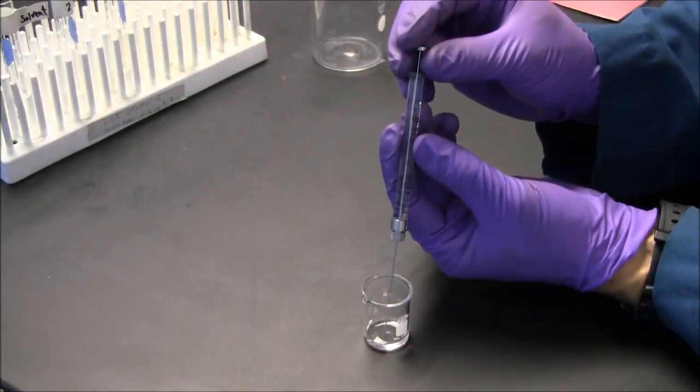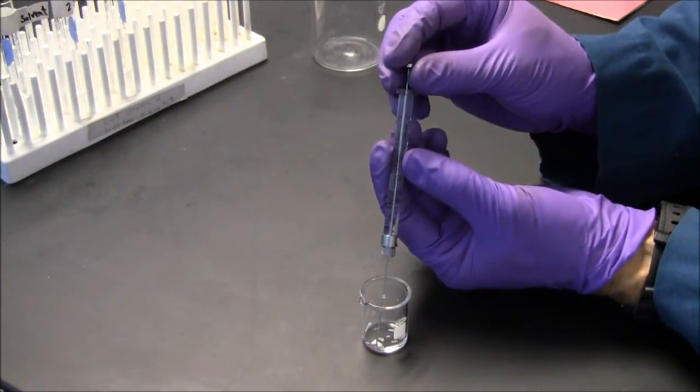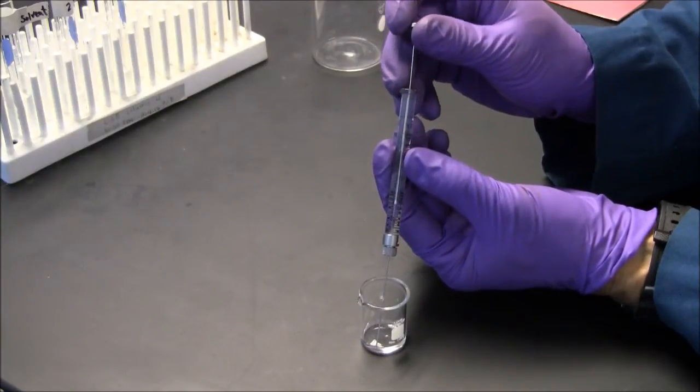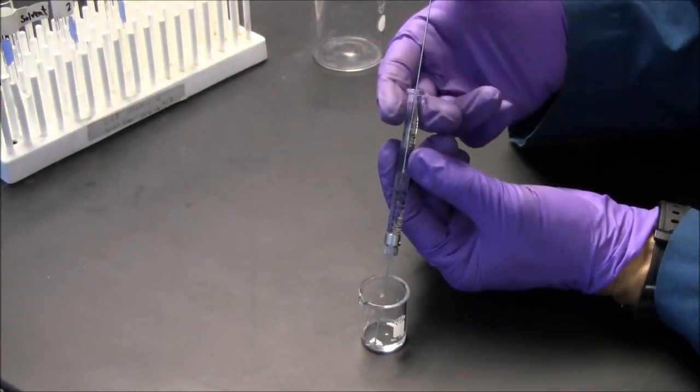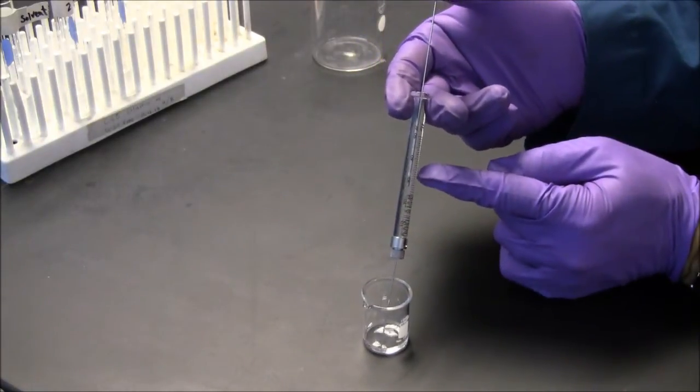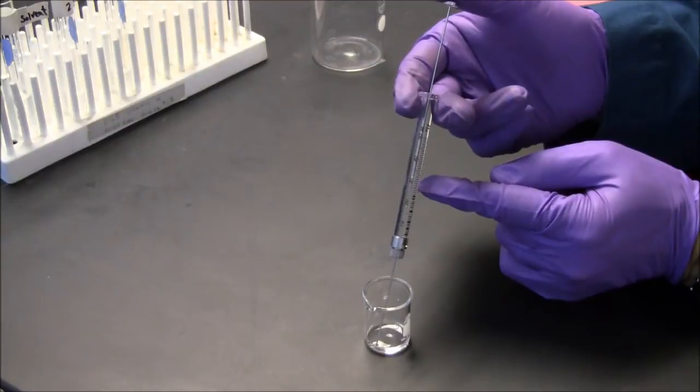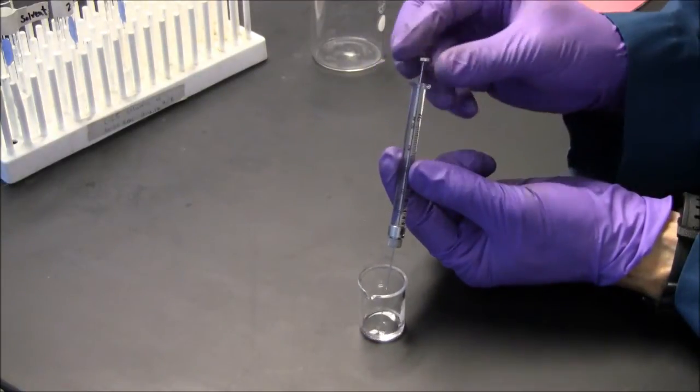So here, use is very intuitive. I will pull up the plunger when the tip is immersed in the liquid. I can see there are air bubbles here, so I'll push this back down and try to get rid of the air bubble.